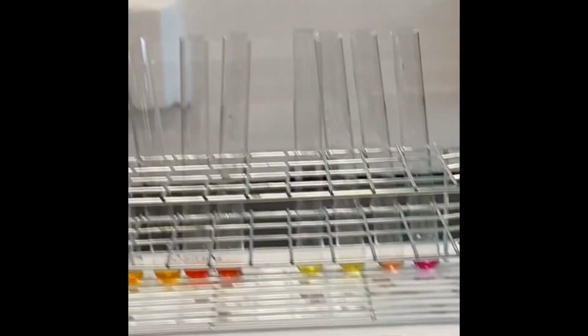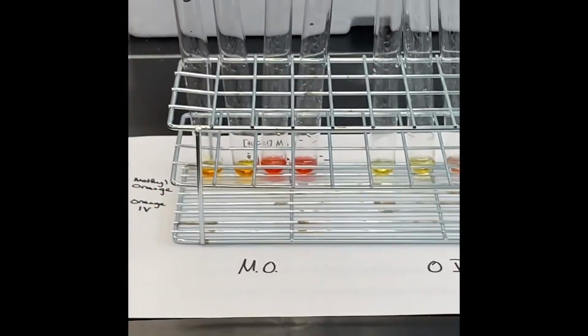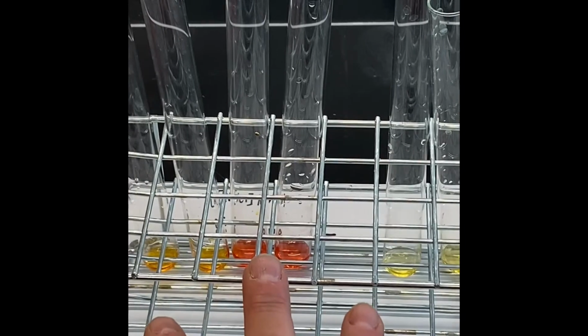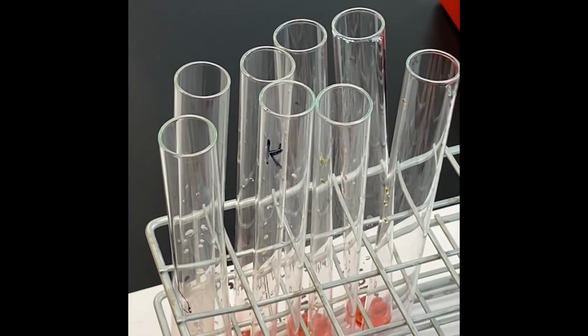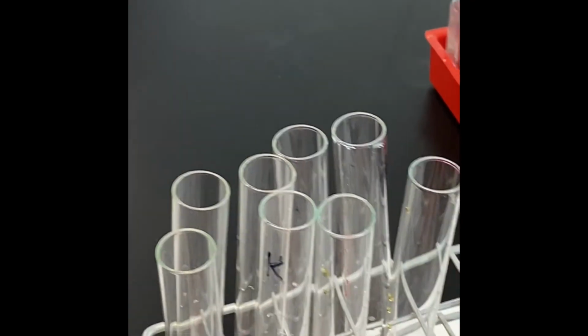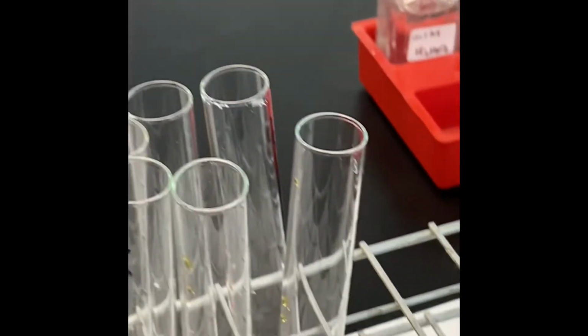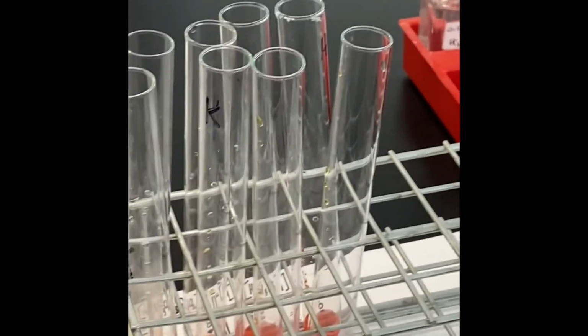Okay, all right, so what you want to do is use those color comparisons. These are the known concentrations. You know what the H plus concentration is for the HCl's. You're trying to figure out what the H plus concentration is for the acetic acids and the phosphoric acids. So that's your task. Match up the colors, figure out what the H plus concentration is, and then you're going to use those to figure out what the Ka's for phosphoric and acetic acid are.